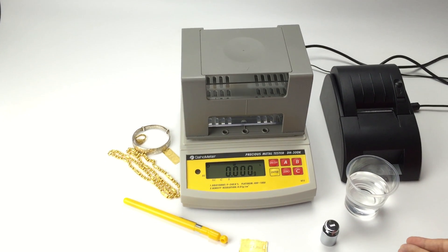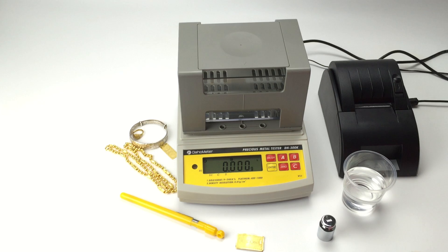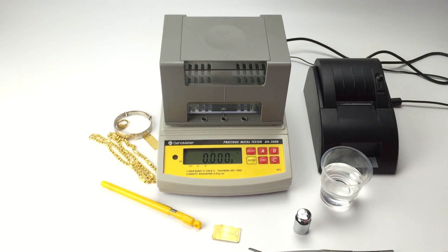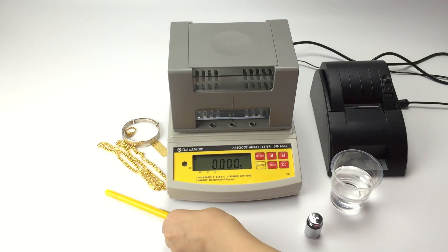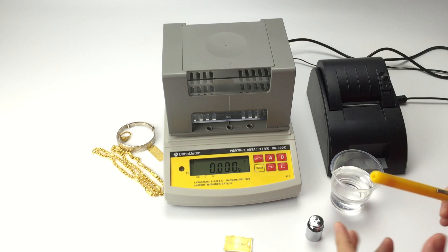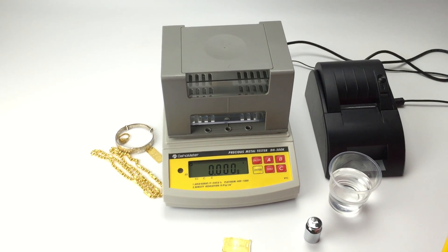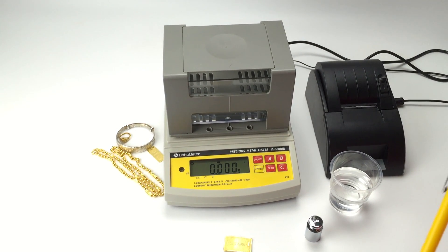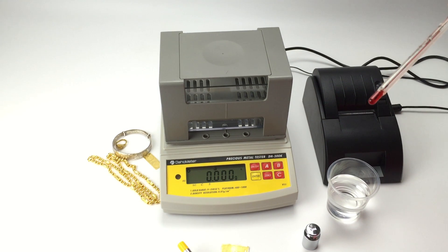The second step is water temperature compensation. Firstly, we need to measure the water temperature with thermometer. This is thermometer.